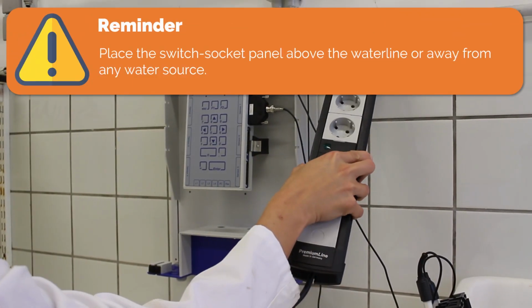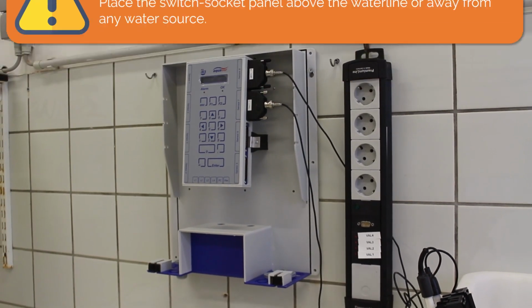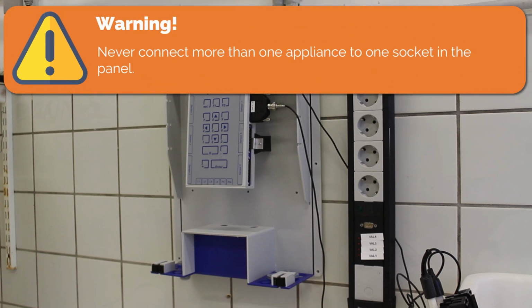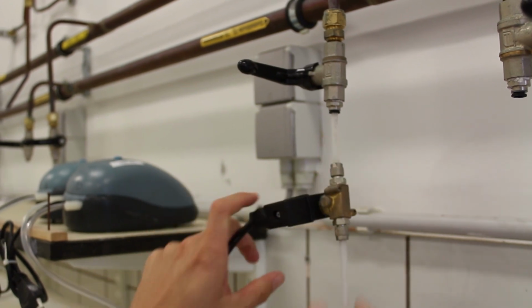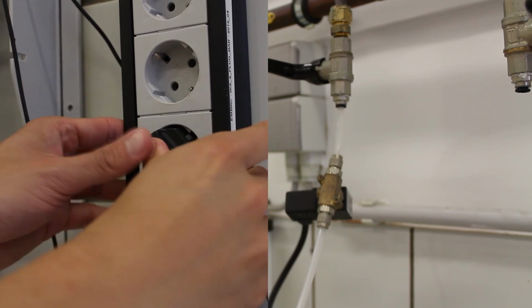Important reminder: always place the switch socket panel above the water line and away from any water source to avoid damage. There are 2 types of switch socket panel: non-variable and variable power outputs. Warning: under no circumstances should you connect a non-variable appliance to a variable switch socket panel. Also, never connect more than 1 appliance to a single socket. In this setup, use a non-variable switch socket panel. To acidify the water, connect the solenoid valve to the CO2 gas supply and the power supply to the switch socket panel. Make sure that the main valve of the CO2 supply tube is closed.